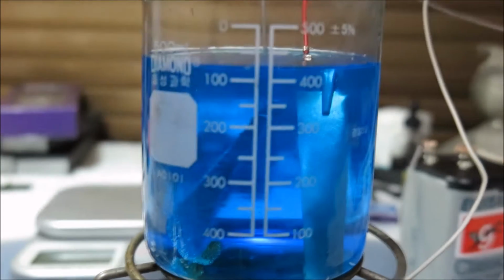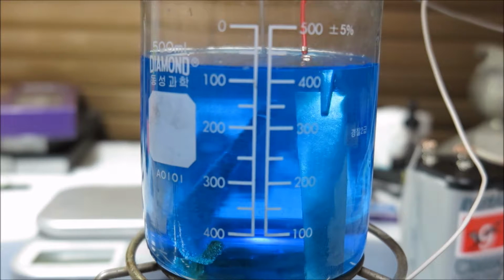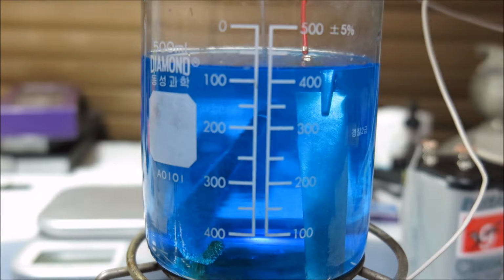And so now this will be the part where I'm going to fast forward for like an hour and 30 minutes or so. So I'm going to pull out the anode and cathode when the solution has turned clear as water. That means the copper sulfate will be completely used up. So yes, okay, I won't talk anymore, and now it's fast forward time. So I think I'm going to fast forward for about 64 times. Okay, so watch.